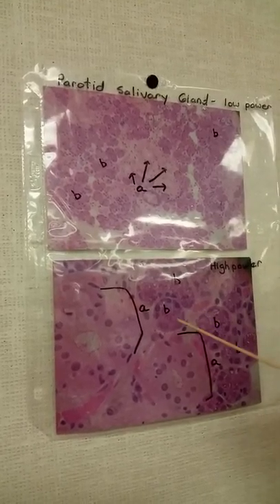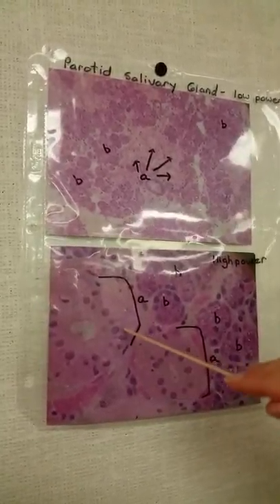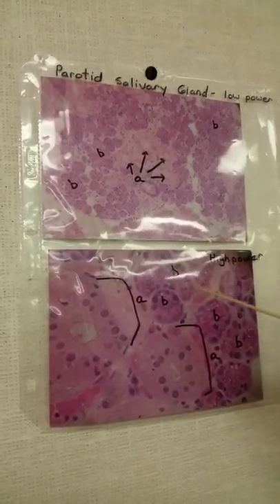In high power, this is the salivary duct. And this is the acinar cells.